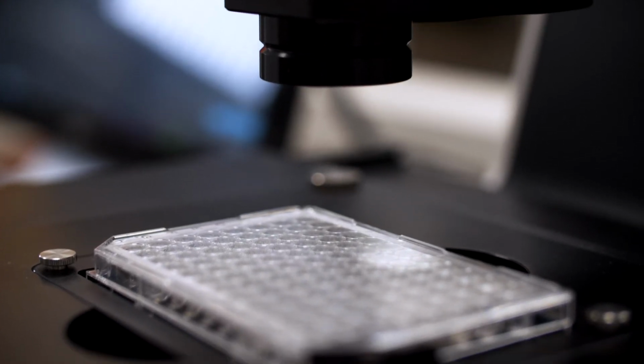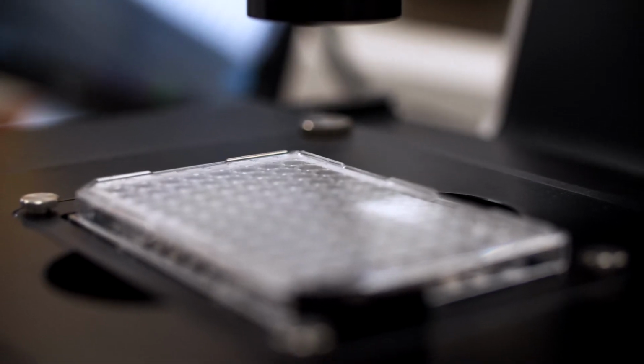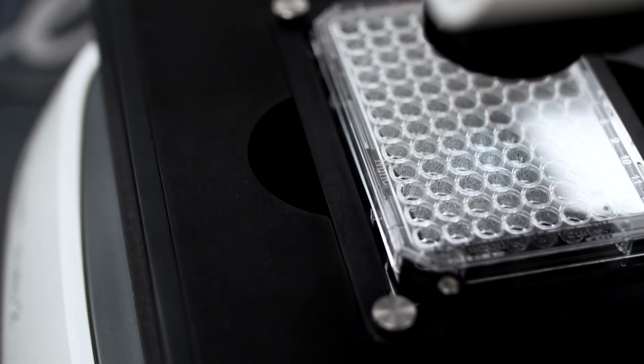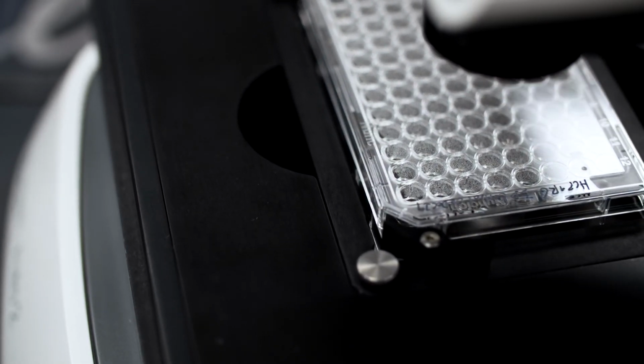That was the best thing, because when you're culturing cells, you're just going by morphology, by what you know from studying and research papers, that this is what they're supposed to look like. But a true form of validation comes when, at the end of your 14-day or 22-day protocol, the actual cardiac cells beat with rhythm, and that confirms that the cells you have are cardiomyocytes. And it's easier to visualize on this because you don't disturb the wells too much, since any disturbance would impact their beating or movement. With the imaging system, without disturbing them, you can visualize their rhythmic movement.